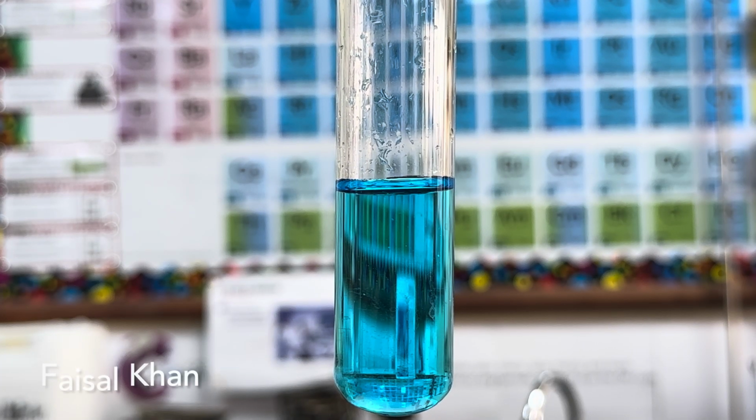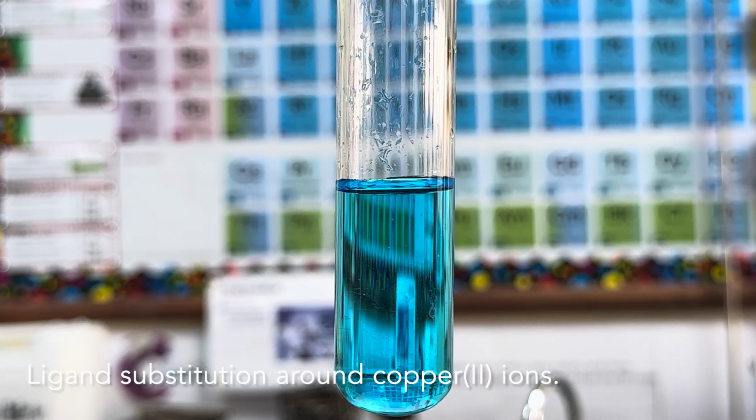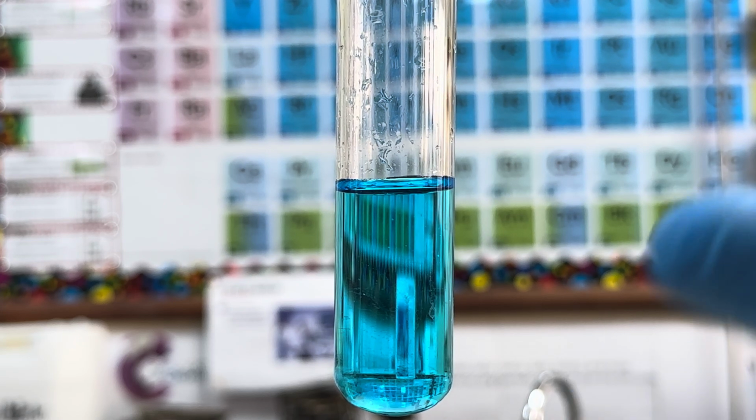Welcome to today's video. Today's video is about the substitution of ligands around copper complexes. Now, the ligands in a complex can be exchanged either wholly or partially for other ligands, and this is a type of substitution reaction. It happens if the new complex formed is more stable than the original complex.